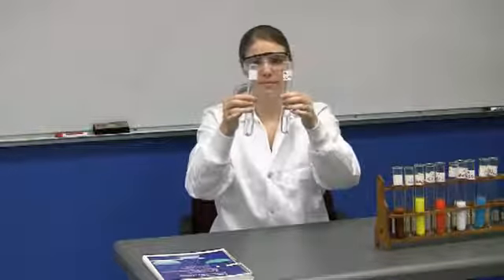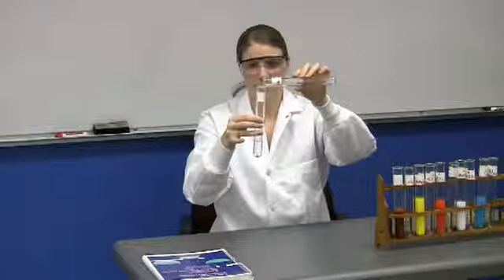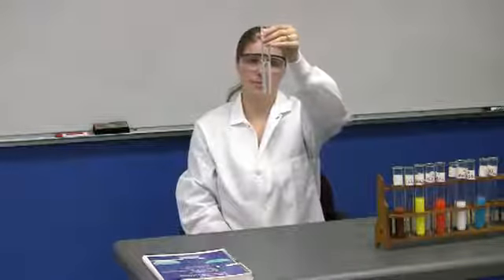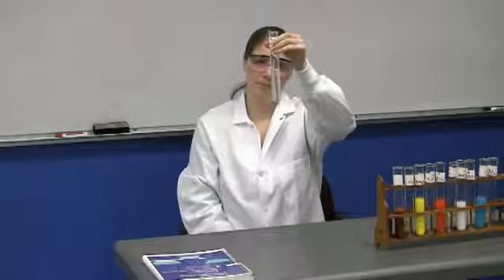Okay, that's our fifth of six, and the last pair of test tubes is going to be mixed now. It contains Na2CO3 plus KI. And this is the case where you see no solid. So when the students predict the products of this reaction, they should have (aq) after the formula of both products, because as you can see, there's no precipitate.